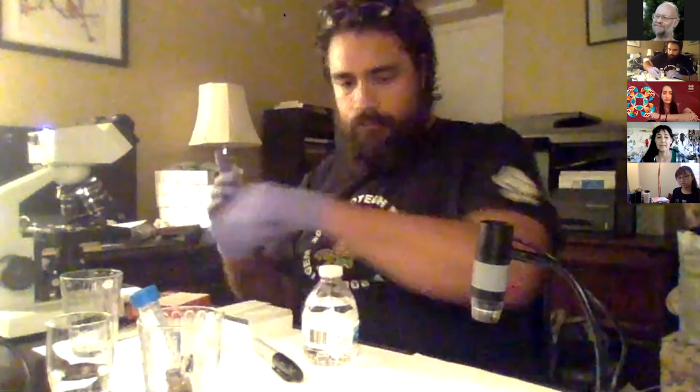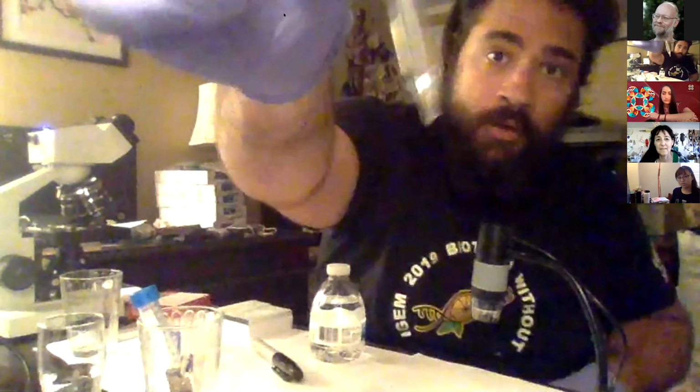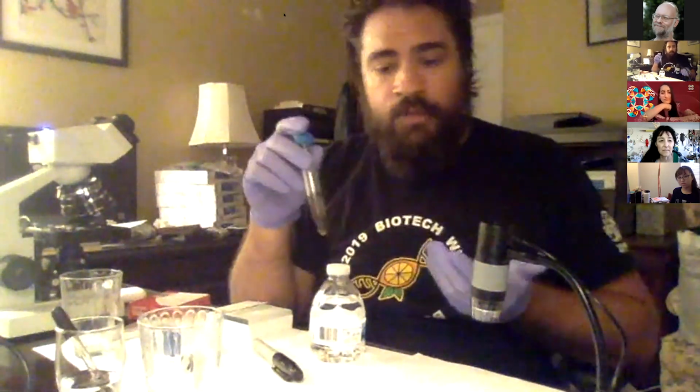We're gonna put our slide onto our surface. Great. And then we're gonna get our little eyedropper, which we're gonna use to put a little drop of our sample. And we're gonna basically wash it out a couple of times, making sure that there's nothing dried out, so none of the microorganisms get stuck to the inside of the actual dropper. All right, so how do we get a good mixture to make sure we get a nice little soil droplet?